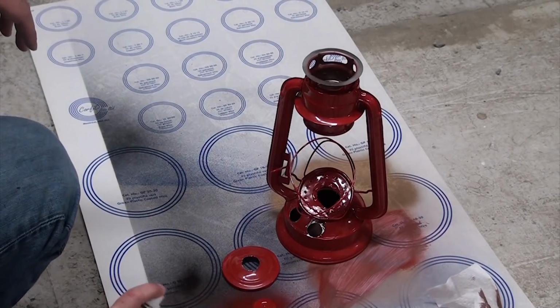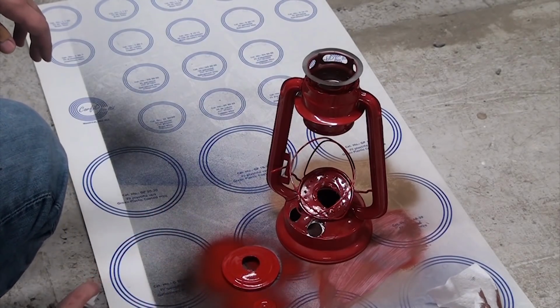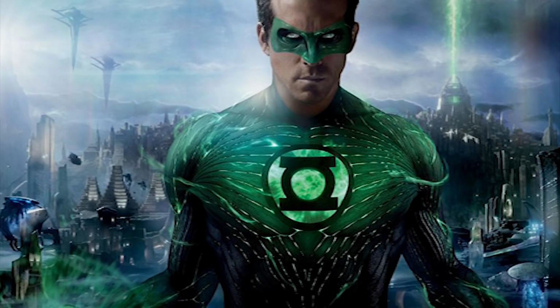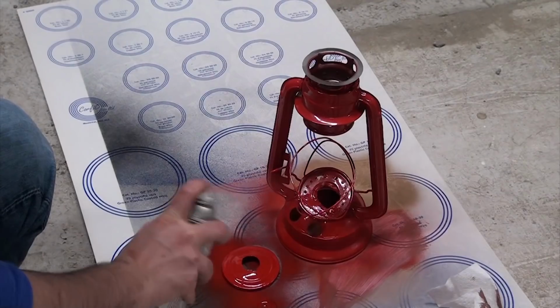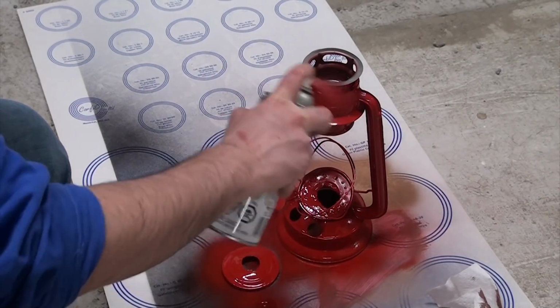After that, everything could get a quick coat of paint before assembly so that all the scuff marks and machining errors were mostly hidden. I'd considered doing green for a green lantern look, but didn't have the budget for a terrible CGI costume to go with it, and ended up just going with more red. I think it preserved the look of the lantern, which I think adds to the aesthetic.